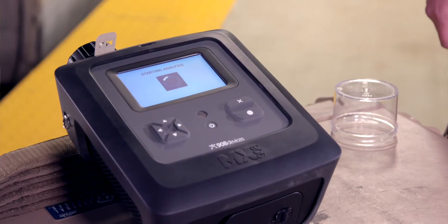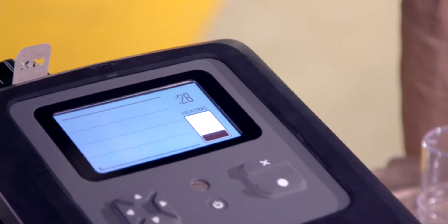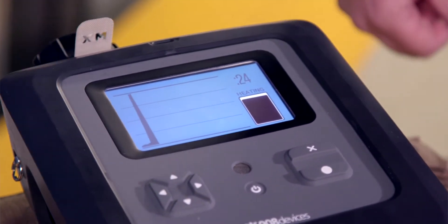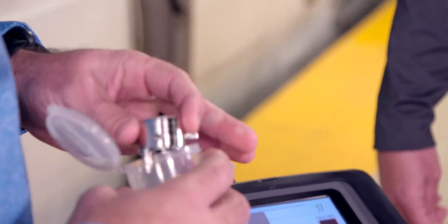The reason we start from the least concentration to highest concentration is you don't want to put too much product into the instrument and cause a saturation problem or a clear down problem later. The good thing about these instruments is if you do get too much product in there and it needs to be cleaned and it's not clearing out, you can literally pop the core out, clean it in alcohol, and put another core in in a matter of a minute. It's just two screws for the core to pop out and replace.